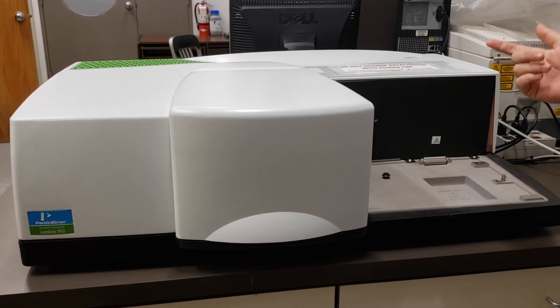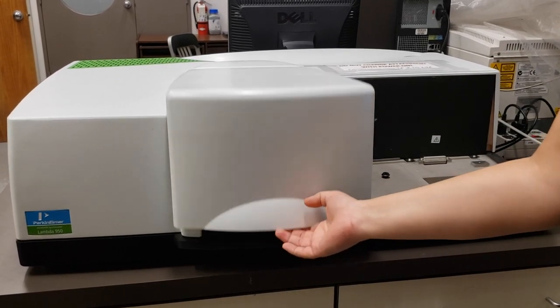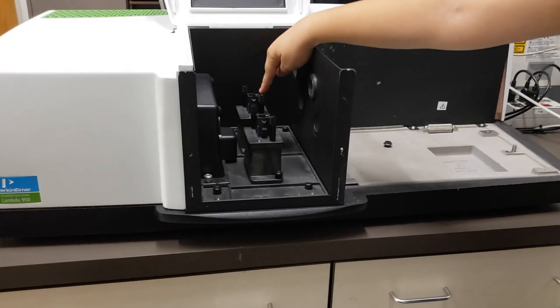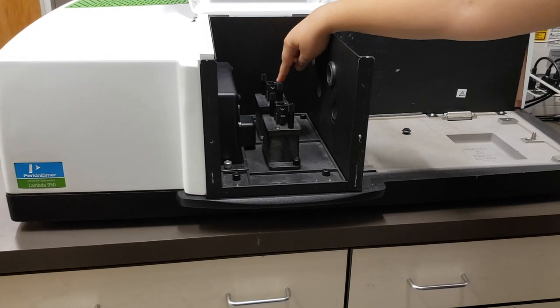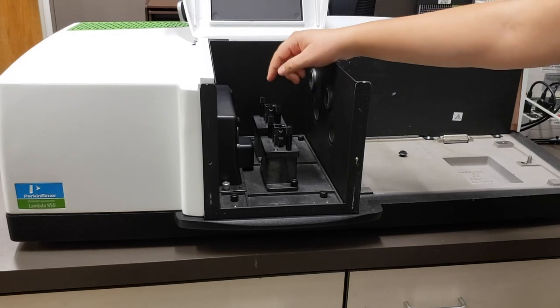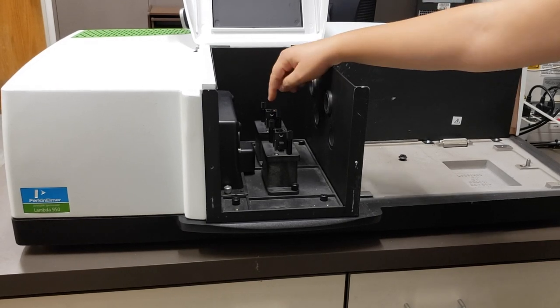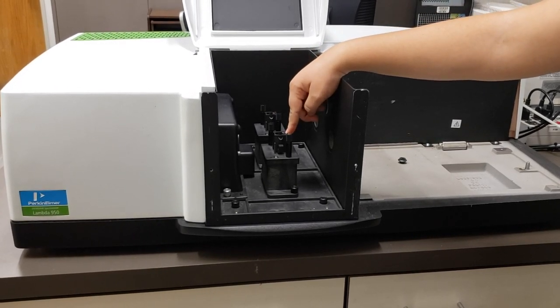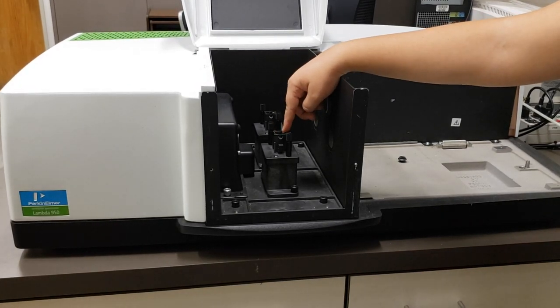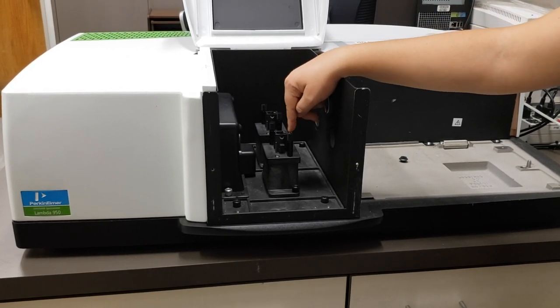Because they have different optics, they have a secondary location where you can put your samples. The main sample holder section has spots for two cuvettes — one in the front and one in the back. The front spot is the sample location and the back is the reference location. If you are working with a solution, you would put your base material in the back and your solution in the front. If you don't have a solution, the back would just be an empty cuvette.